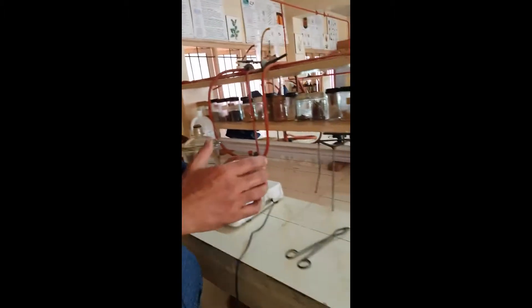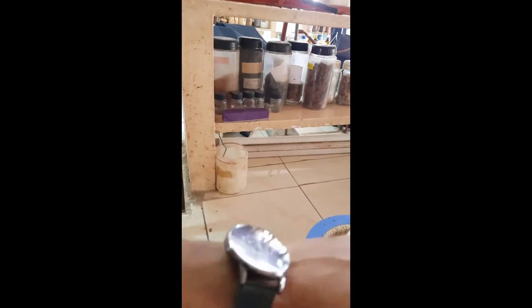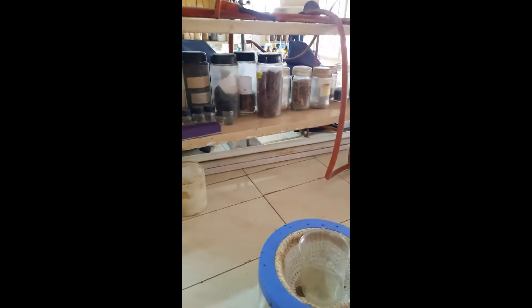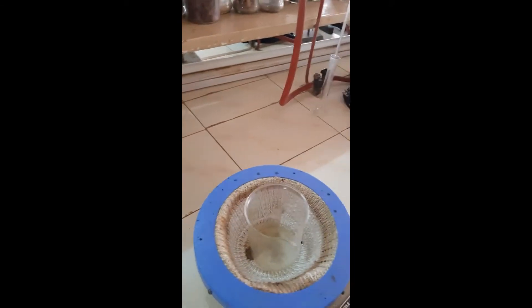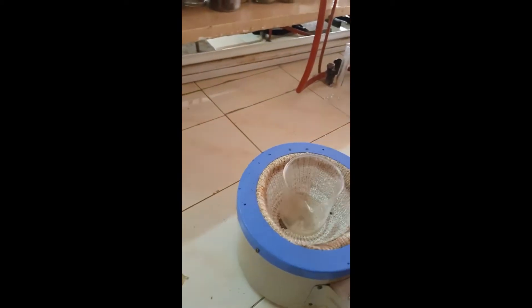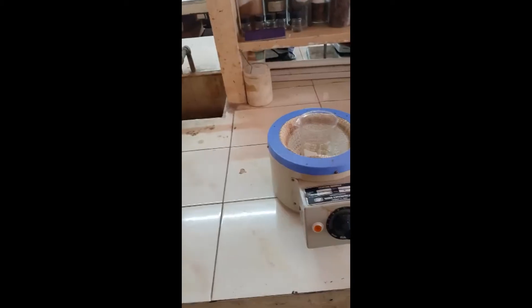Now I am keeping this on the mantle for 15 minutes. You have to note the time for 15 minutes — the time is now 11:10. For 15 minutes you have to wait, and occasionally you have to stir this, because it contains insoluble matters and soluble matters. In dilute hydrochloric acid, the soluble matters will dissolve and the insoluble matters will not dissolve. So you have to heat this for 15 minutes.